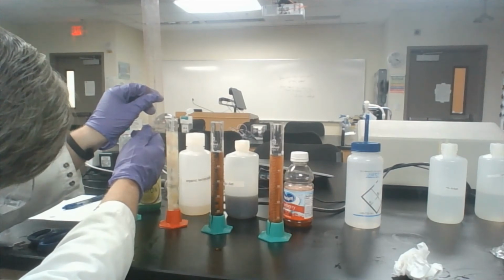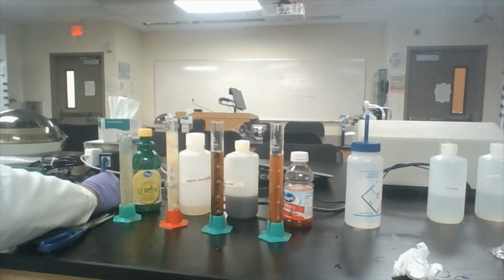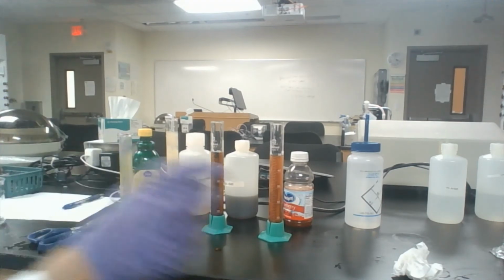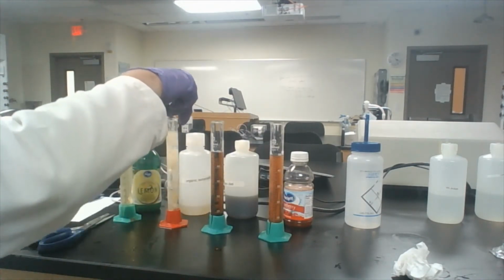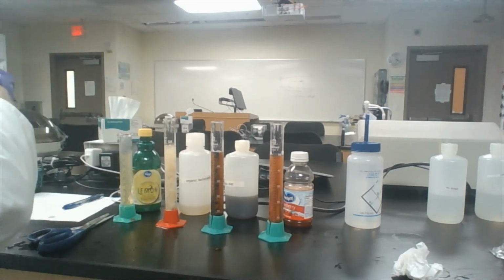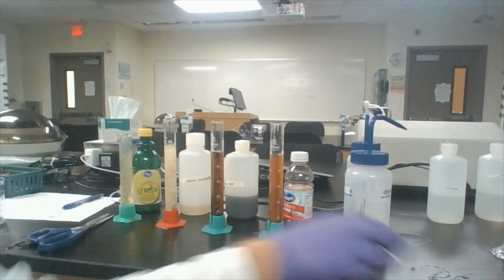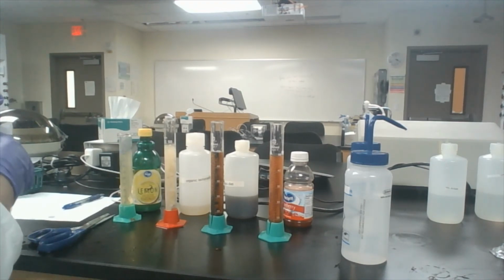Word to the wise in the future. So that is 31 millimeters, once we clear the pulp, anyway. So there's some question about whether that's accurate or not because of the presence of the pulp. Also I should have done that one last, because now I have to make sure I clean the pulp off, because the pulp will now add mass, and if I don't clean it all off, it will weigh down my hydrometer.